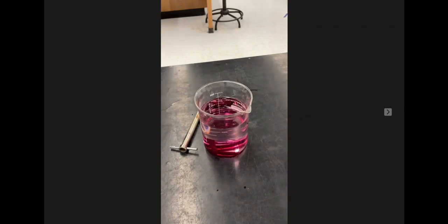For the next step, you will soak your beet samples in tap water for 2 minutes. This is to wash the beta-cyanin from the surface of the cells that were punctured while carving out your sample using the borer.